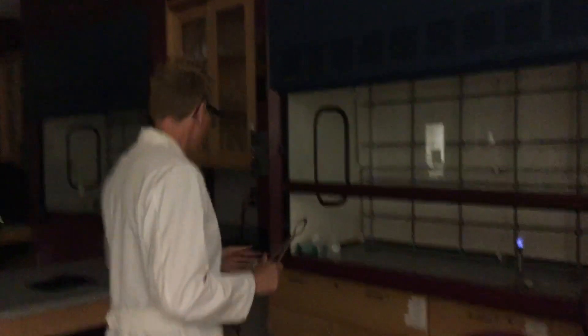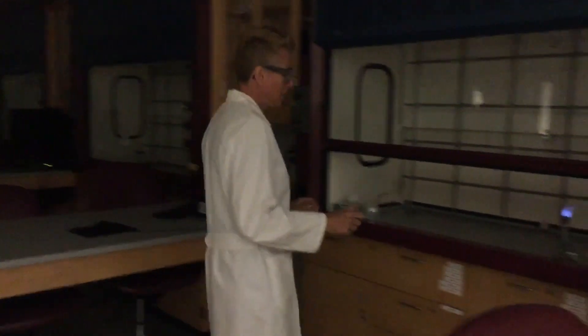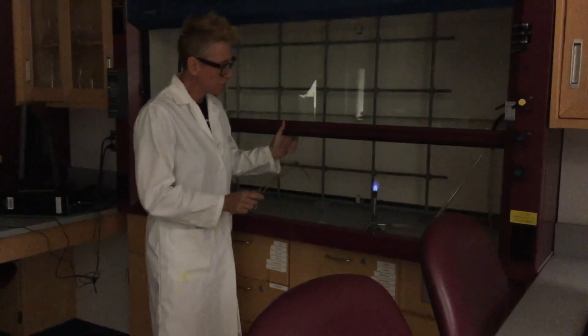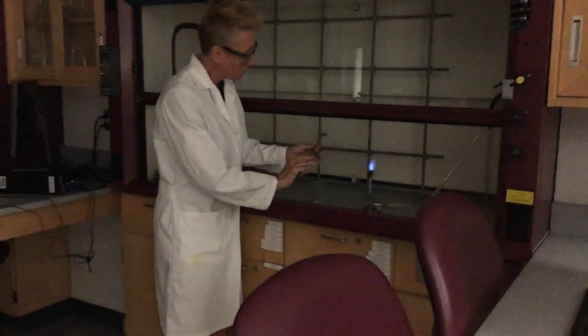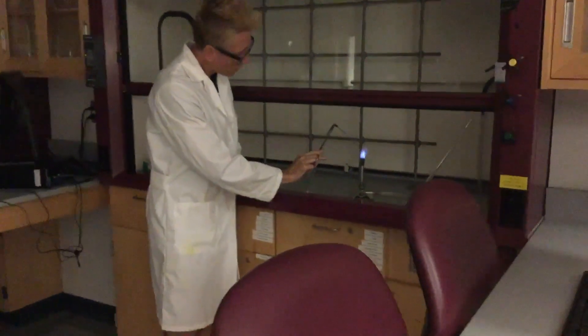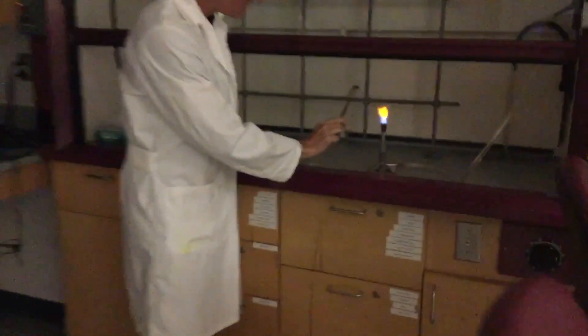Come on over here and we're going to go to the fume hood. I have the lights turned down just so you can see the reactivity of the oxygen and the magnesium, and the white light that gets produced when we burn magnesium.